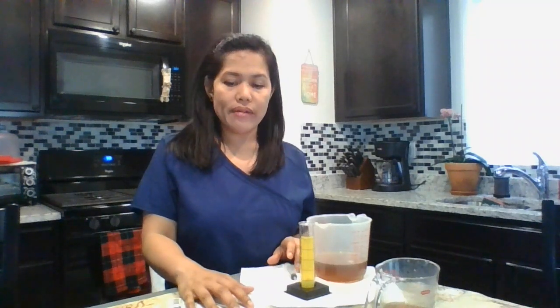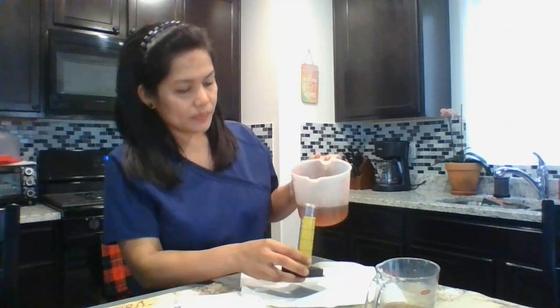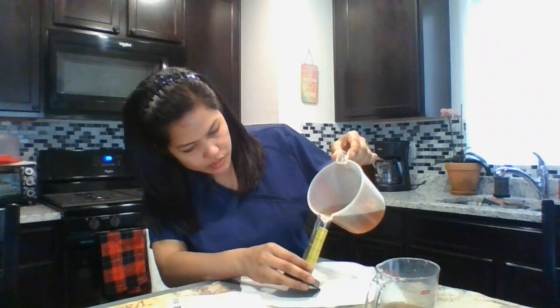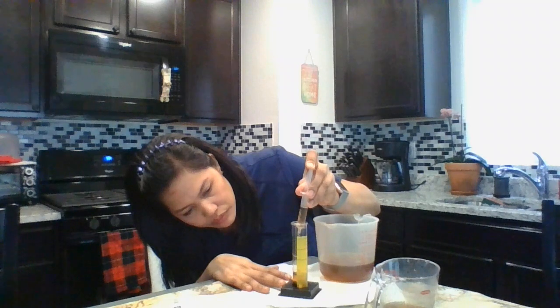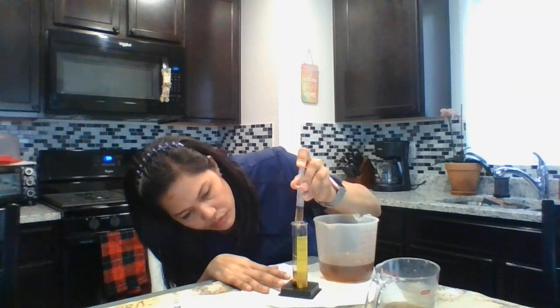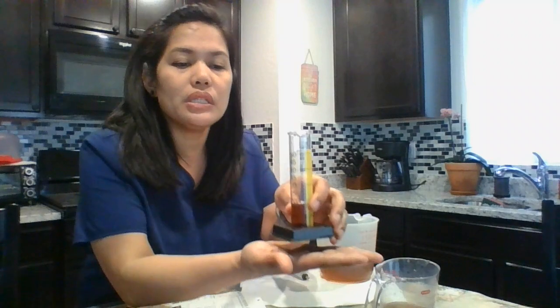Number 3: I have 17 milliliters times 5 equals 85, so I'm going to measure 17 ml. This is 17 ml.